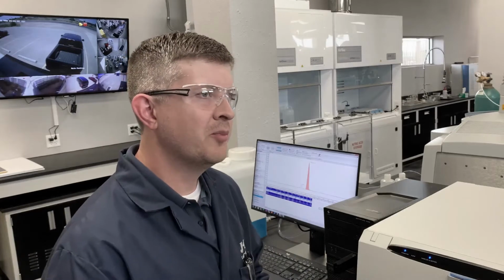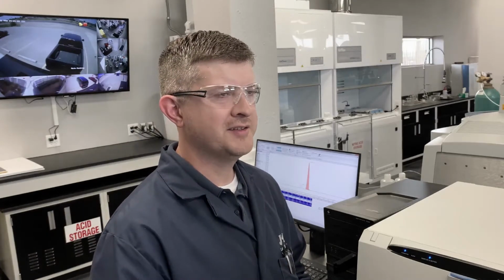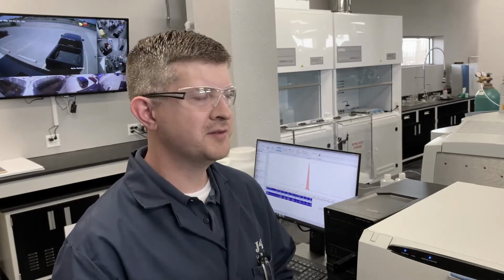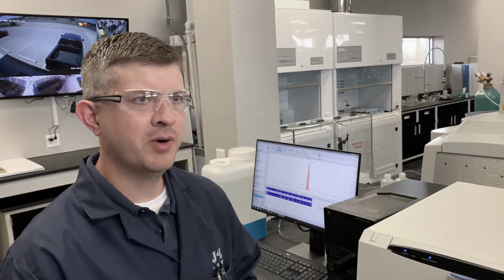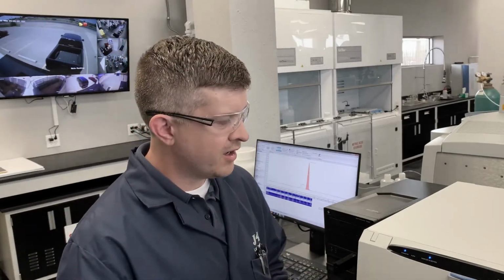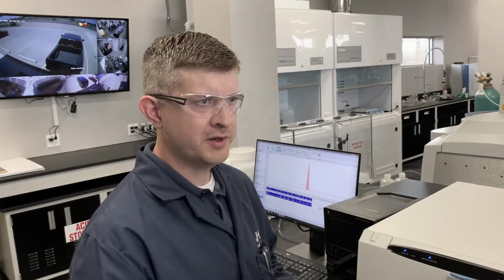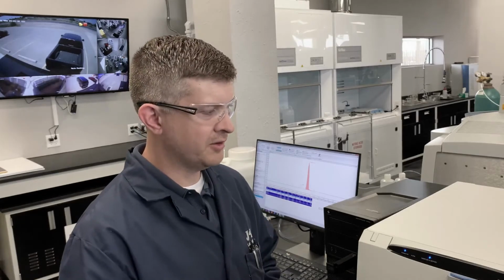And the reason that a company would want to know about organic acids is it affects both corrosion and scale modeling. So for a company to have an accurate corrosion and scale model, they will need to know the organic acid components. So we do scan all four components here at J&L using the Dionex IC, and it offers sample prep automation for us, so we can load up 60 organic acids, press a button, and then go do something else. Come back later, and we have 60 samples run for us, ready to report out.